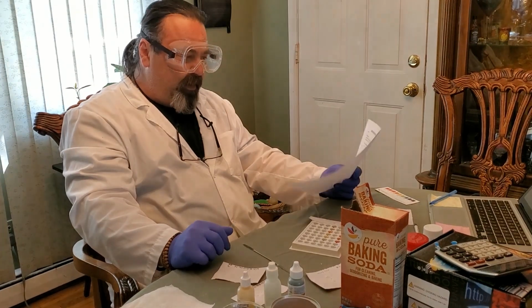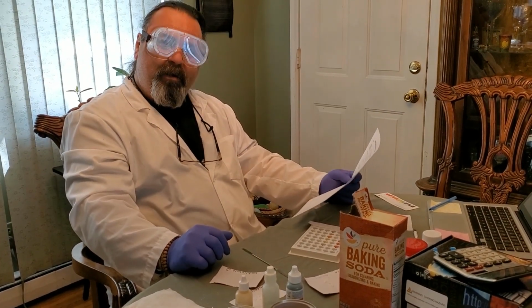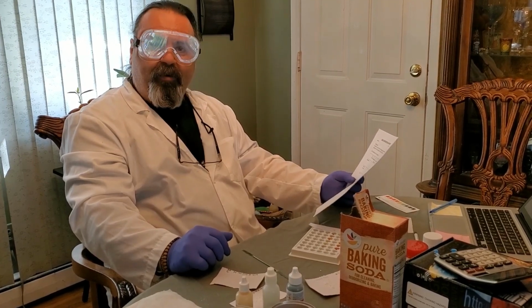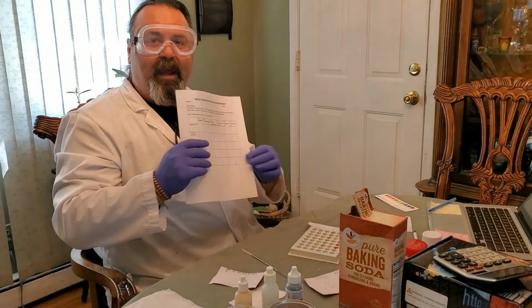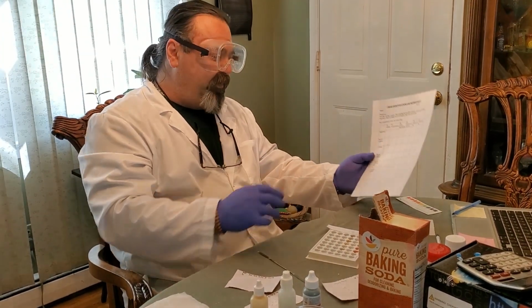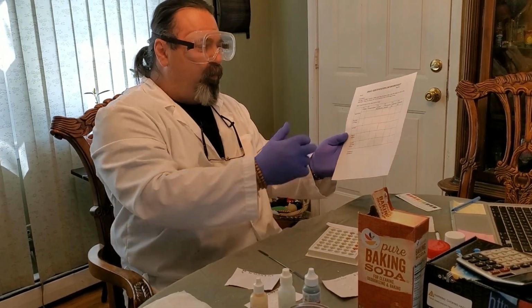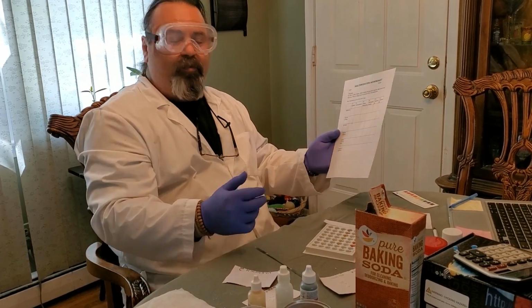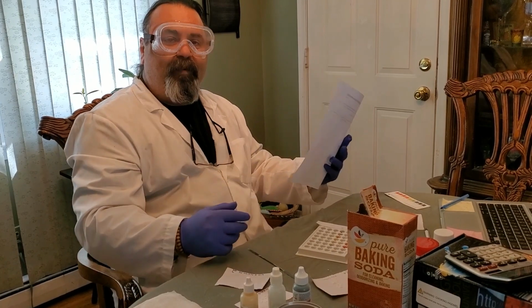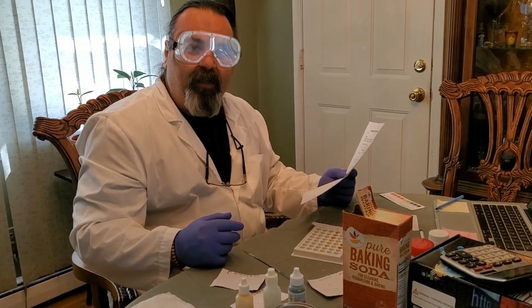All right, so that's part one of our lab today. Finish up any of your observations on the lab worksheet. Based on the observations that you have seen, see if you can figure out what unknown 1 and unknown 2 are, and then write them on the bottom of the sheet. Obviously, type them into the work doc that I've provided.